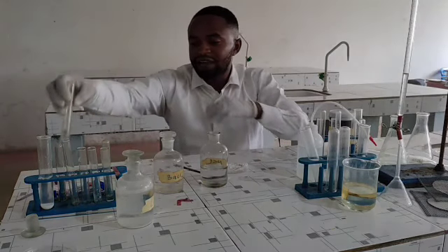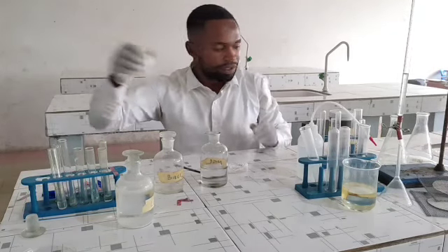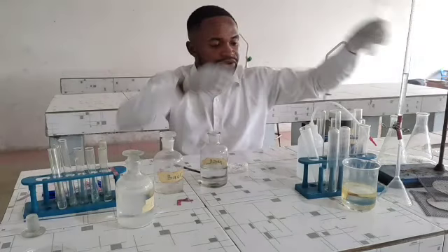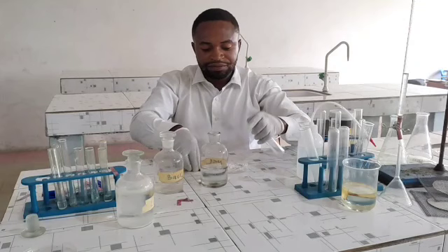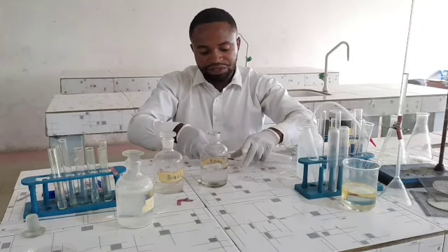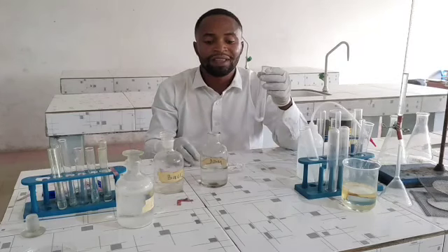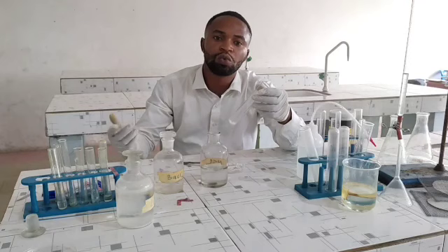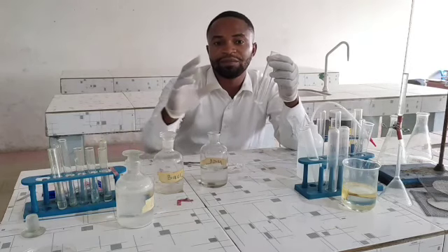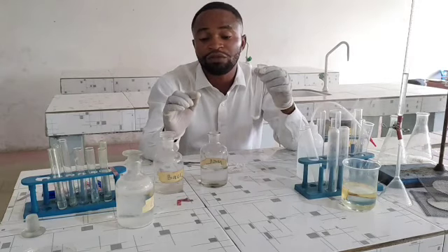The next test the examiner may ask you to do, or on the next question, they may ask you to take sample C. Let me use this test tube. I have many test tubes. They may ask you to take about half a spatula of sample C and put it in a boiling test tube, or any other test tube, and heat gently. They may tell you to heat gently or to warm, whatever language the examiner uses. You should have an understanding of the principle.